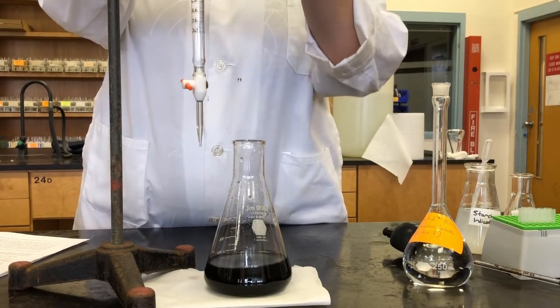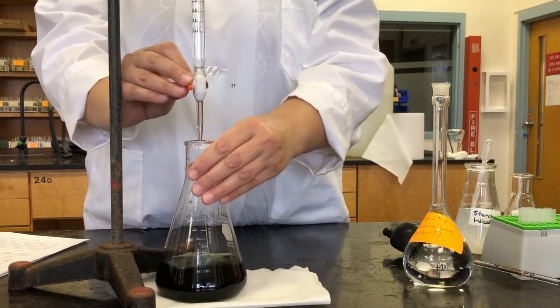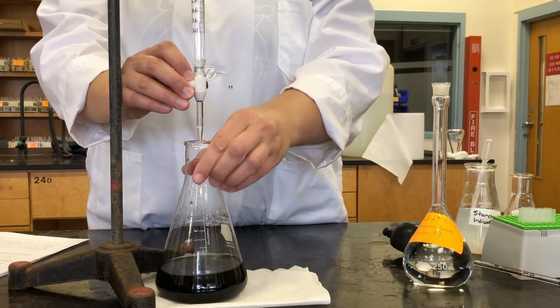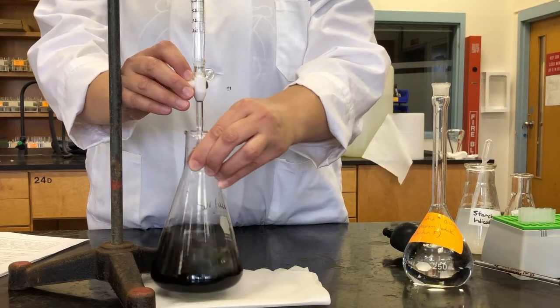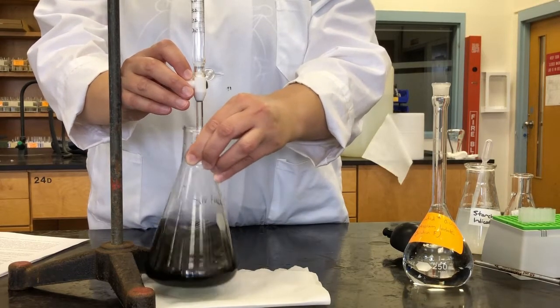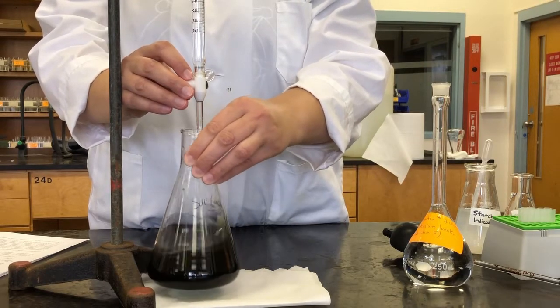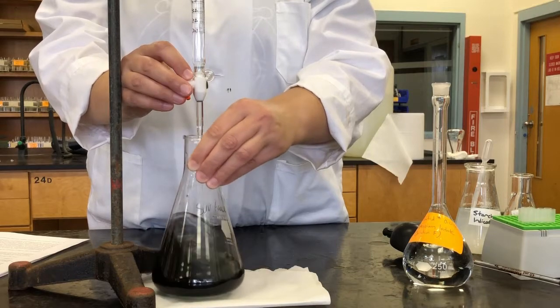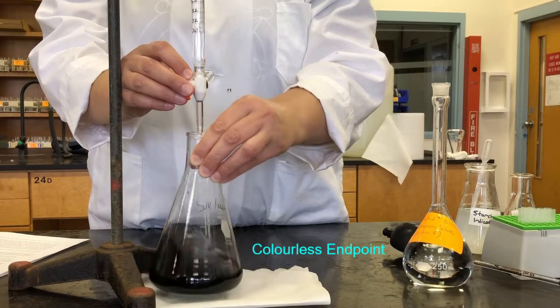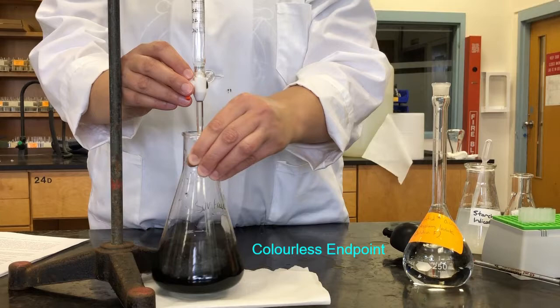I'll lift my burette a little bit. So we'll take our initial reading and then we'll start the titration. And we have a better idea this time about how much solution we have to add because we did this titration before, so we know about how much it takes, which is helpful. I mean, we can move things along a little bit faster. And remember, we're looking for a colorless endpoint. So as soon as that blue color is gone.